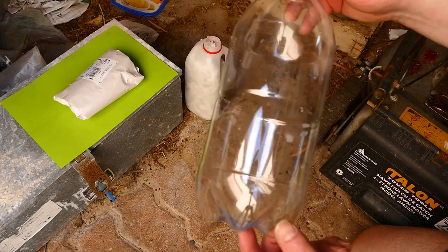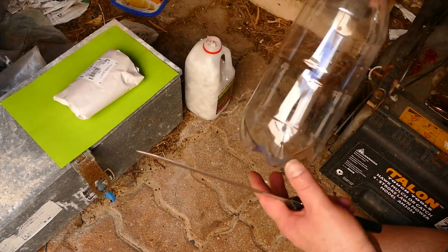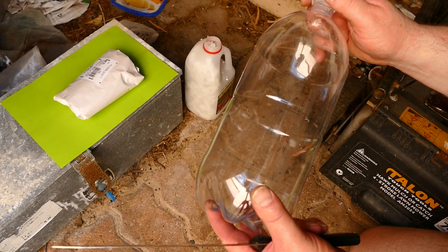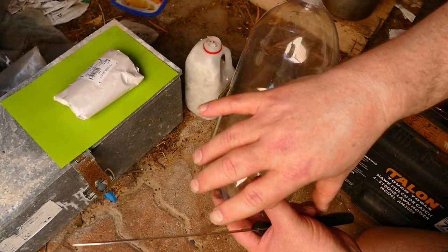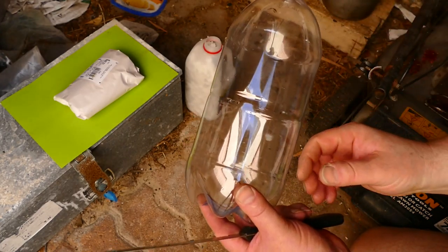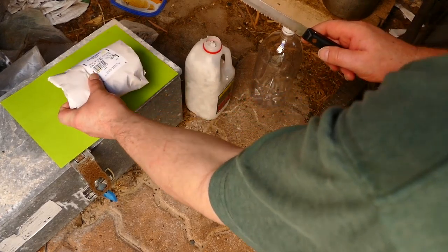This one I'm going to put a nice chunk in the bottom and then fill it up with polystyrene, so we can enact what we've learned from the polyethylene cling wrap — that it probably absorbs the reductive flammable gas, so your only reductive flammable gas environment, or anaerobic to semi-microaerophilic, is down the bottom, which seems to be where the organism wants to grow.